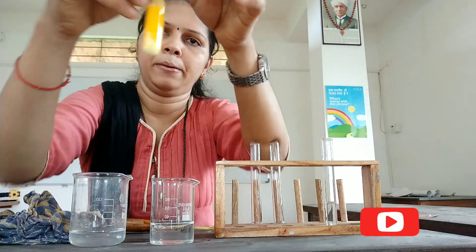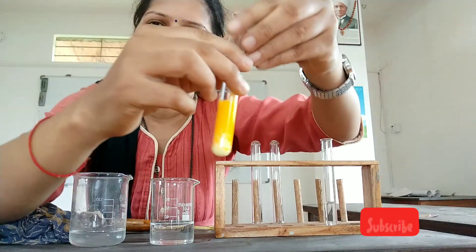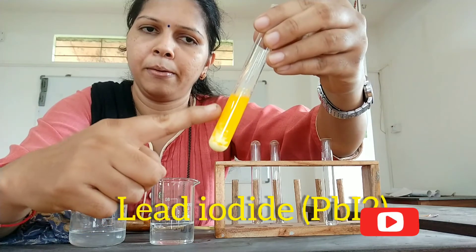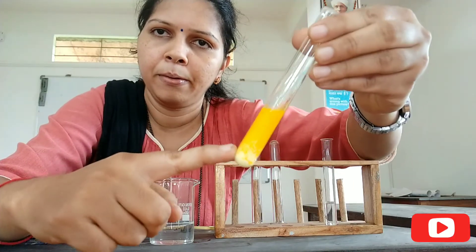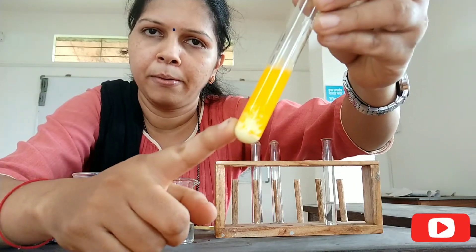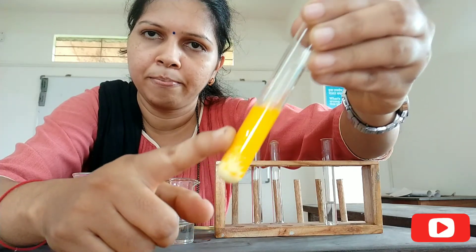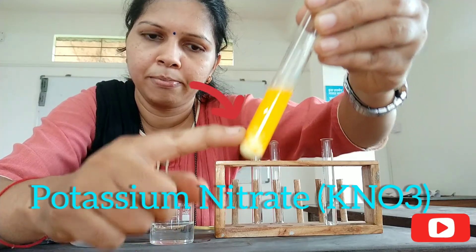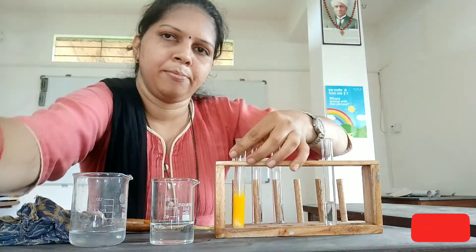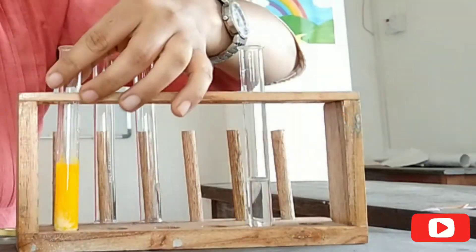What is the cause of this? The yellow precipitate of lead iodide is formed by the reaction of lead and iodine. The other product formed is potassium nitrate, which is soluble in water. Lead iodide is insoluble in water, and as a result the yellow precipitate is formed.